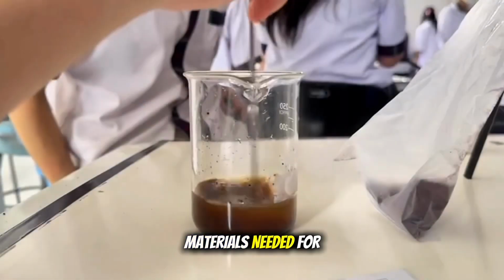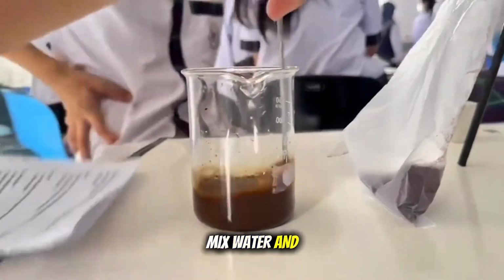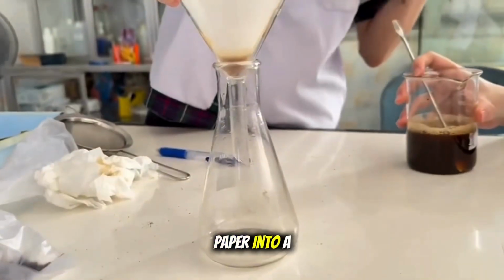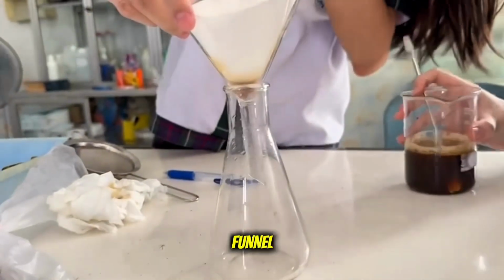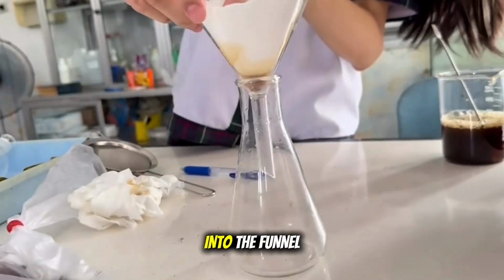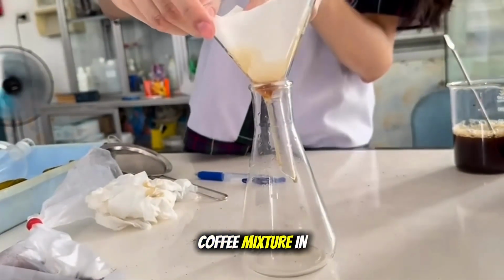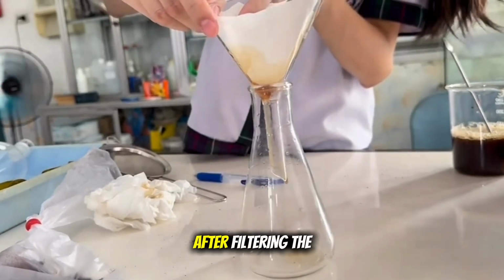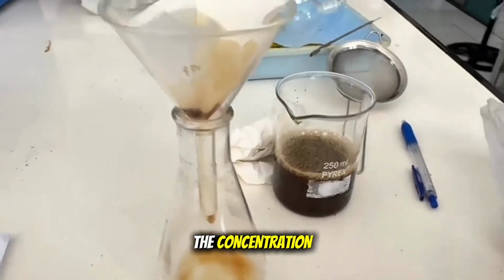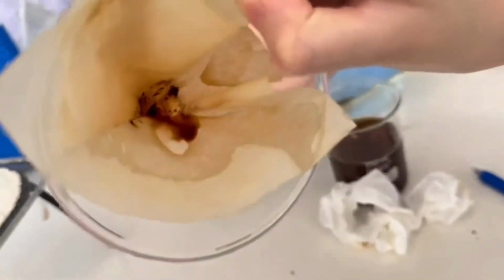Filtration. Materials needed for filtration are water and powdered coffee. Mix water and powdered coffee in a beaker. Fold the filtering paper into a cone and place it in the funnel. Pour the mixture of coffee and water slowly into the funnel. Monitor the results by seeing the coffee mixture in the funnel. After filtrating the mixture, you can analyze the difference in the concentration of coffee and water by telling them apart by the color.